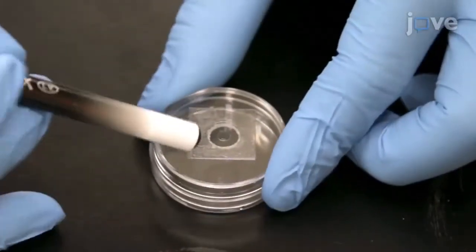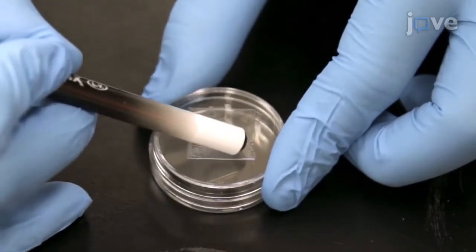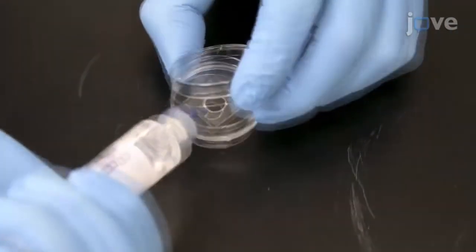Apply pressure to the adhesive contact surface to create a complete seal between the cover slip, adhesive, and petri dish, taking care not to crack the glass. Use sterile filtered PBS to rinse the hydrogel.